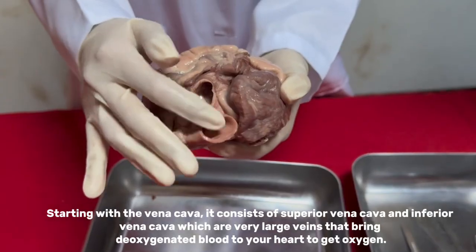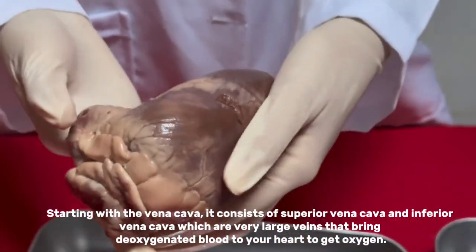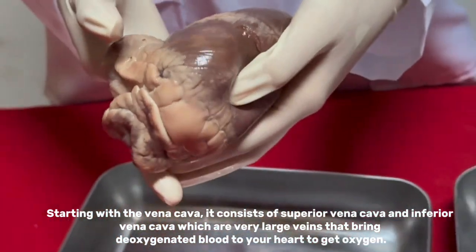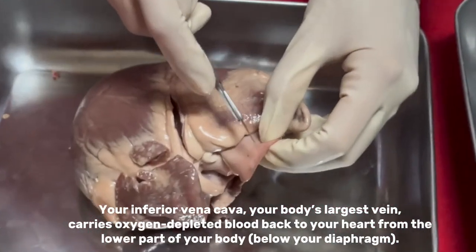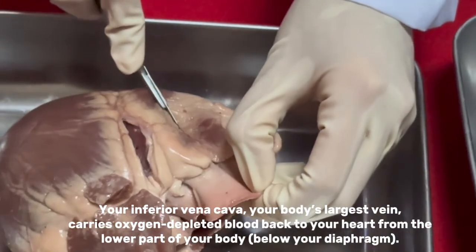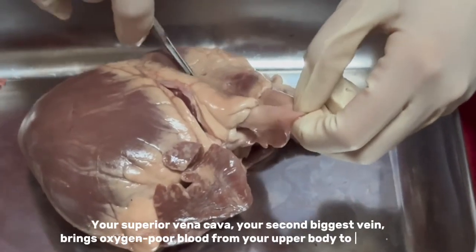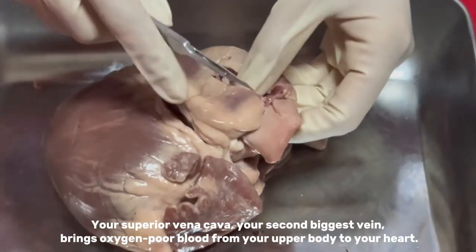Starting with the vena cava. It consists of the superior vena cava and inferior vena cava, which are very large veins that bring the blood back to your heart to get oxygen. Your inferior vena cava, your body's largest vein, carries oxygen-depleted blood back to your heart from the lower part of your body, or below your diaphragm. Your superior vena cava, your second biggest vein, brings oxygen-poor blood from your upper body to your heart.